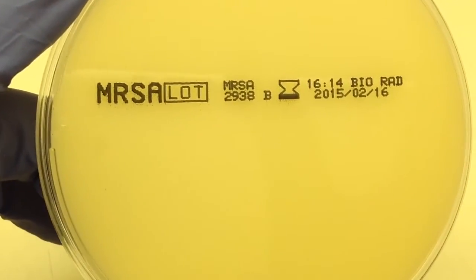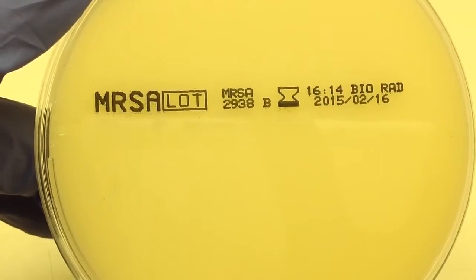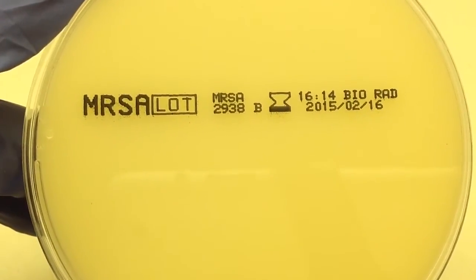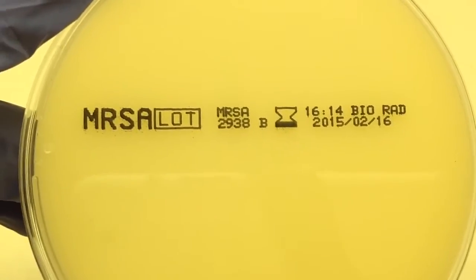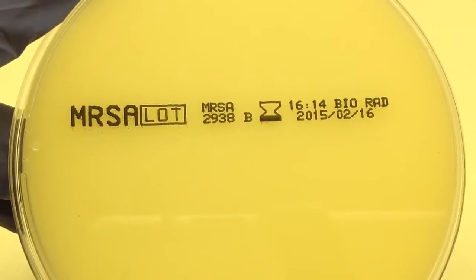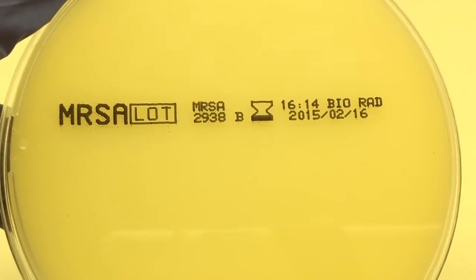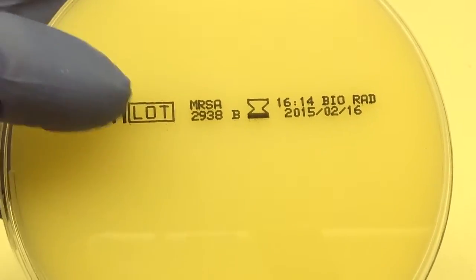This is chroma agar, and this is for MRSA — methicillin-resistant Staph aureus. Its purpose is to detect MRSA. It's going to suppress the growth of gram-negative organisms. Other staphylococci are going to grow on it, but they're just going to be basically white. And our MRSA will have kind of this mauve color on it.